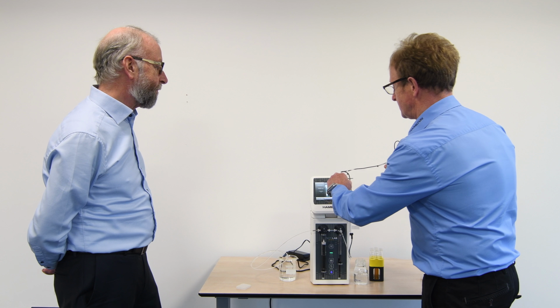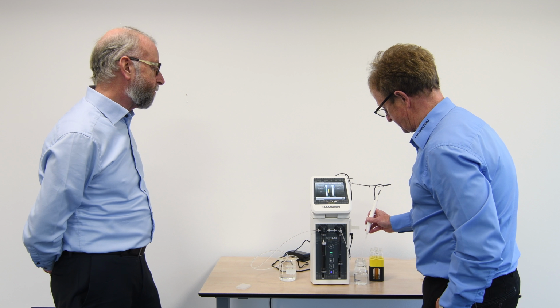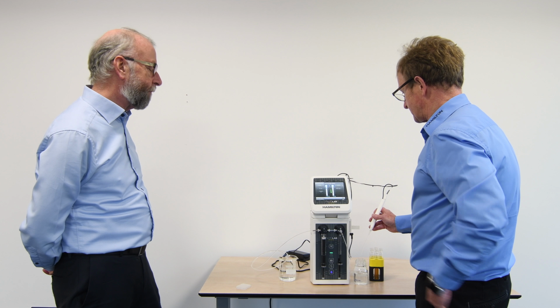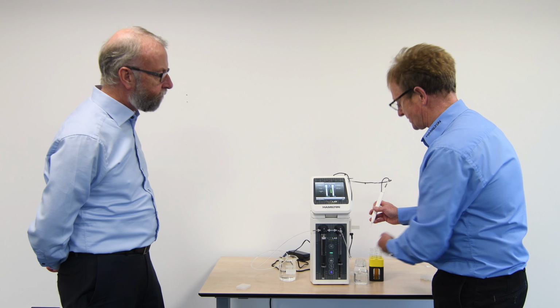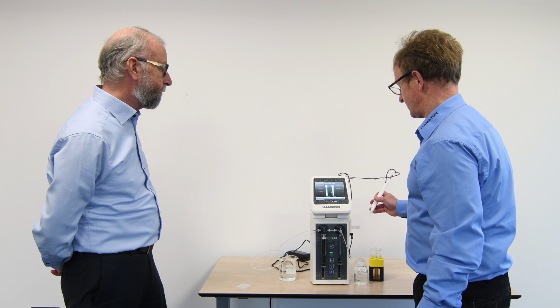And now it's telling us to dispense a wash reagent to waste. So I can actually now put to waste the wash reagent. This is an optional step for large sample volumes. Exactly, so it's told us exactly where we are. It's moved from picking up our sample, telling you what you're doing with that, and moving through the stages right to the stage where it's washing any potential contaminant across.